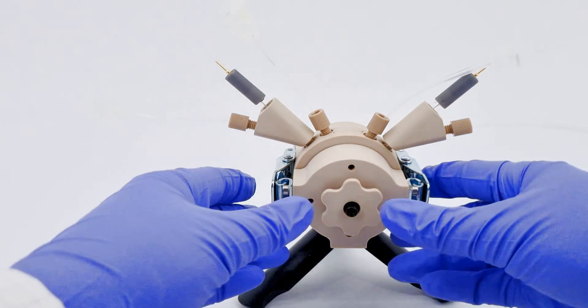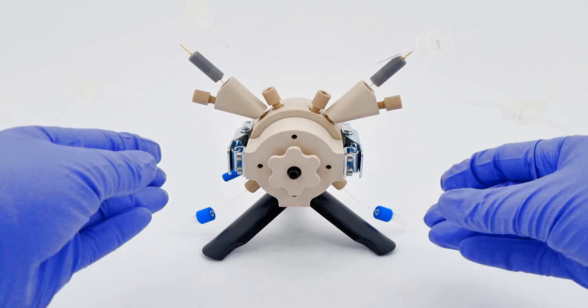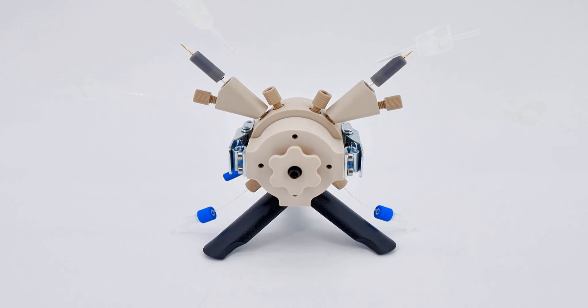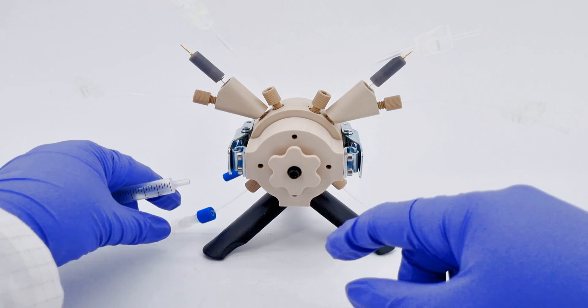Almost there. Now for our electrolyte. We're demonstrating using a static electrolyte today, but the process is pretty similar if you're using a flow cell.